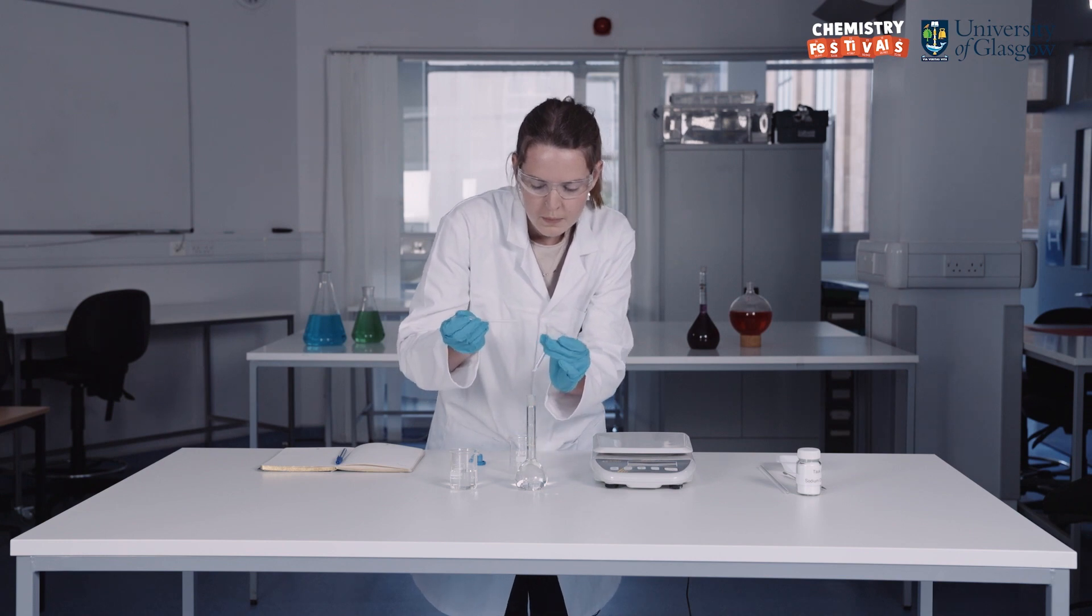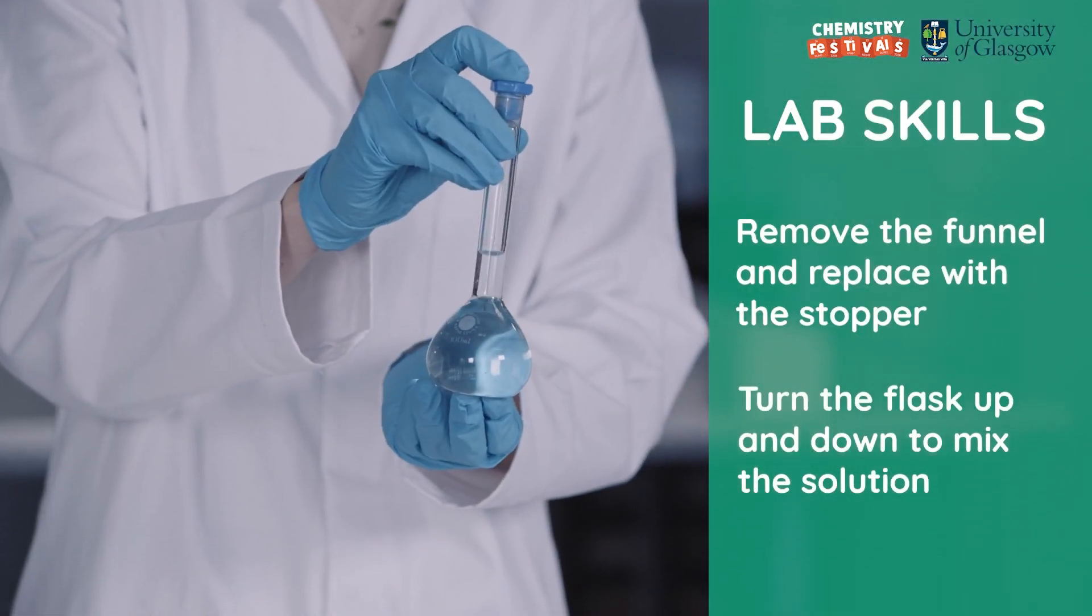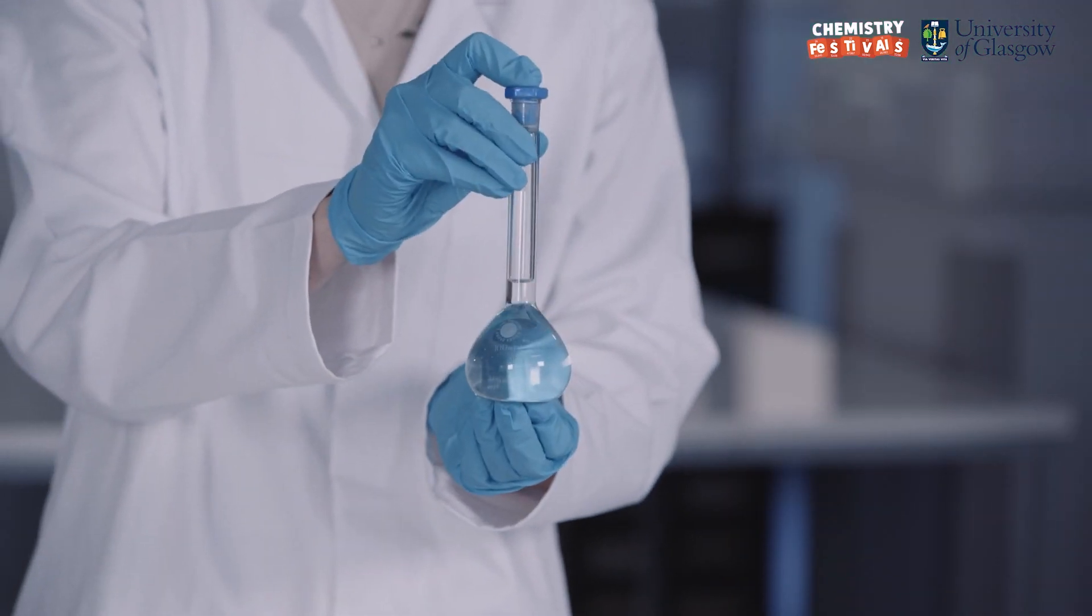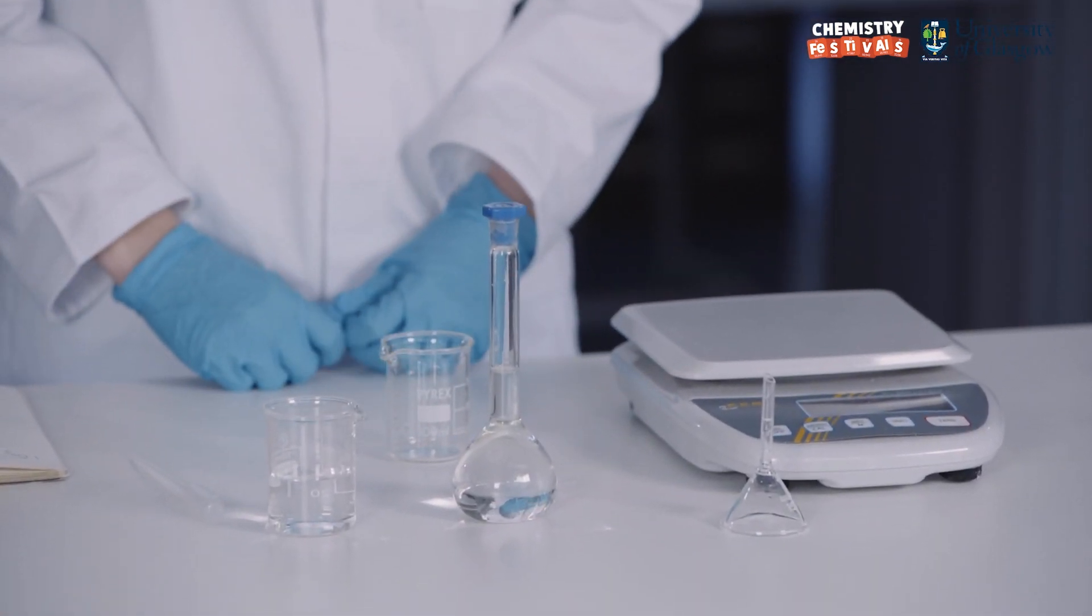Remove the funnel and add the stopper. Invert the flask several times to make sure everything is mixed thoroughly. I've now made a standard solution of sodium chloride. This is a really useful technique throughout chemistry.